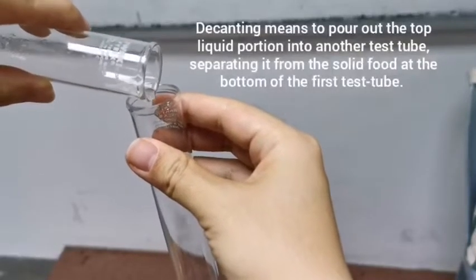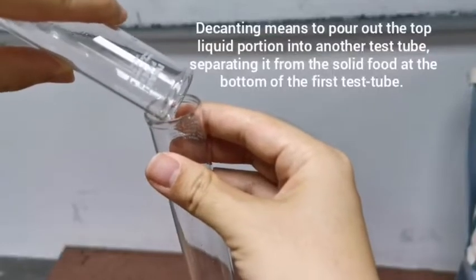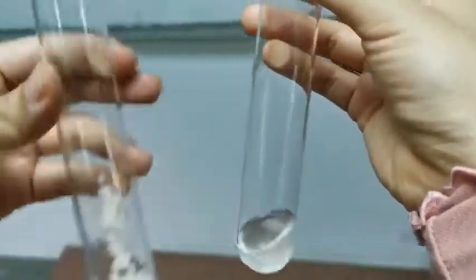This is the process of decanting. We are just pouring the liquid portion very carefully into another clean test tube or clean boiling tube. So what we have here is the solid material left and just the liquid solution.